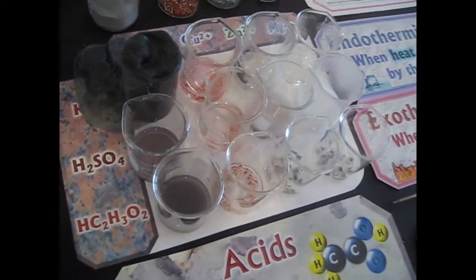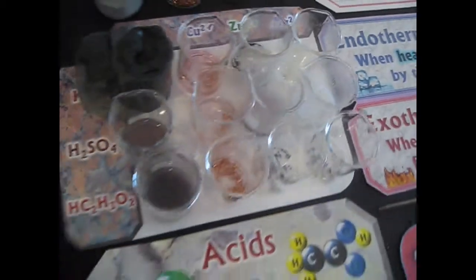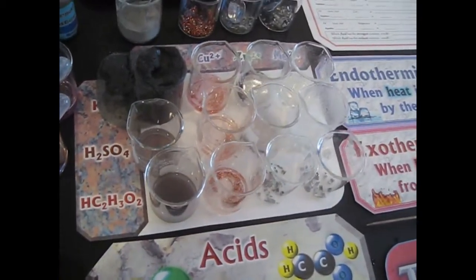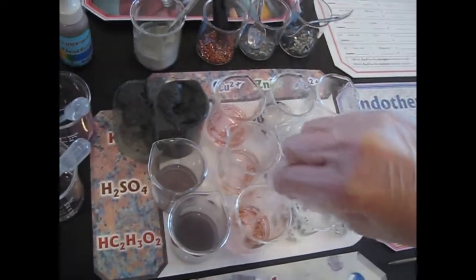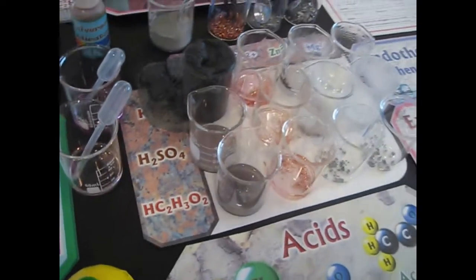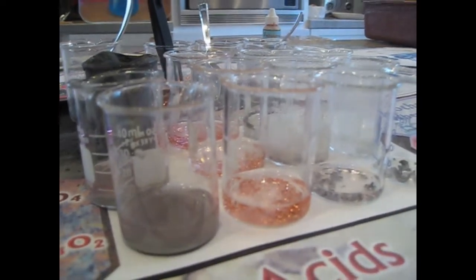So far, the copper hasn't done anything in any of them. Interesting. Just sitting there. Good observation. So let's see if it takes a while to start or if it just is a non-starter. Oh my god, I can still smell it. Which one do you think you're smelling? This one and this one. Okay, keep going.